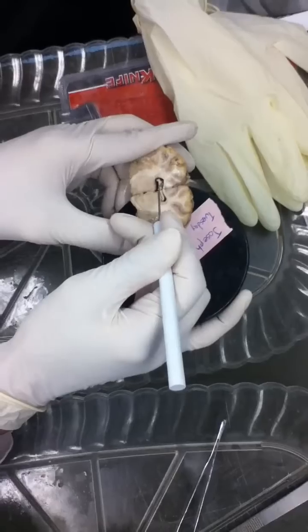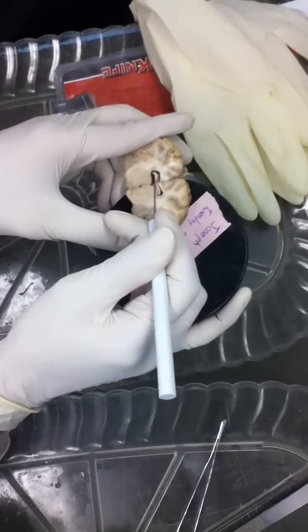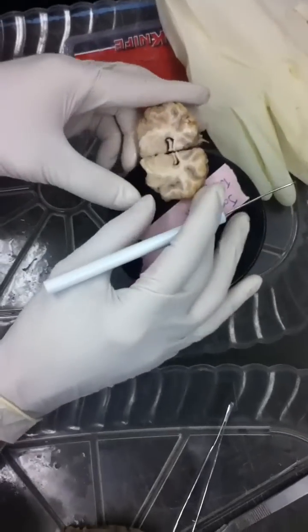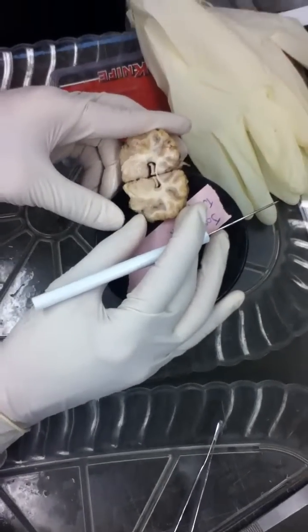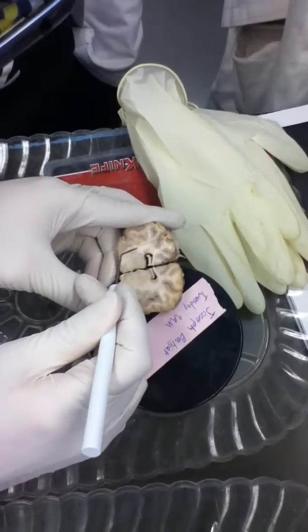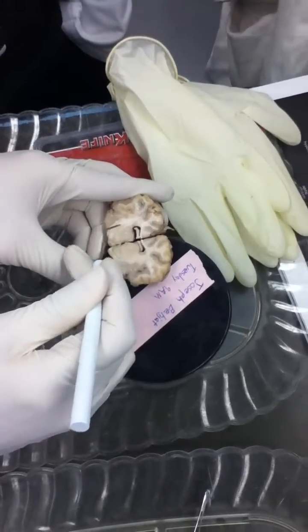If you think of it, you can think of the ceiling of the ventricle as the corpus callosum, and the floor of the ventricle is the fornix, right? What else do we have? Again, we have this thing. It's the same as before. What was that? That trunk of the tree.